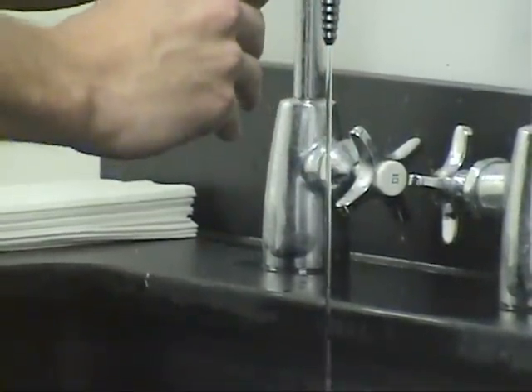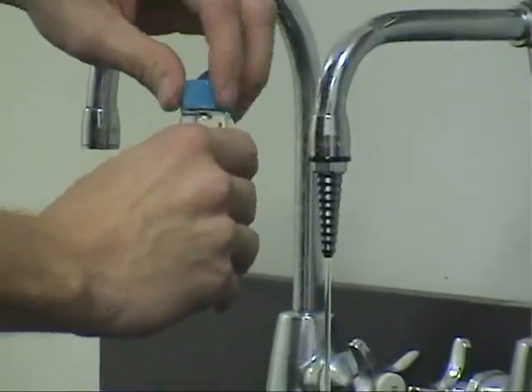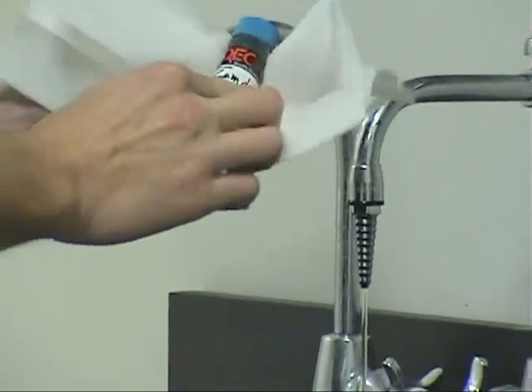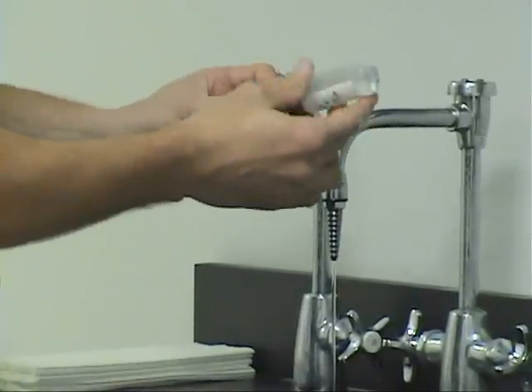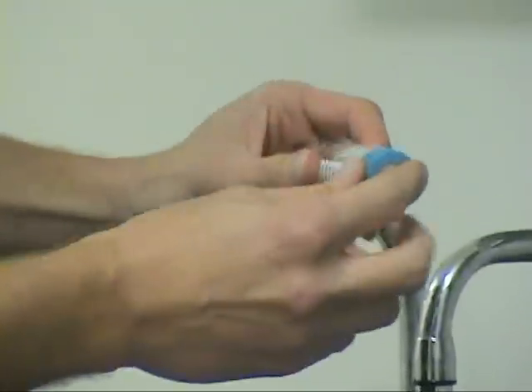You may fill the cap with a little water and quickly close tightly onto the sample vial. Turn the sample upside down, checking for any air bubbles. The sample may be rejected by the lab if air bubbles are present. Keep the samples at 0 to 6 degrees centigrade and return to the lab promptly to meet quick holding times for these samples.